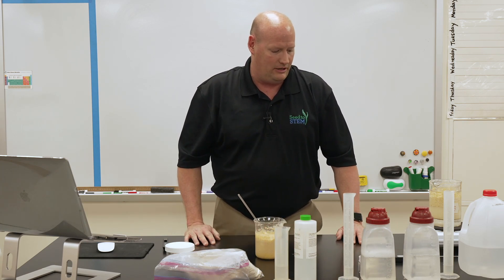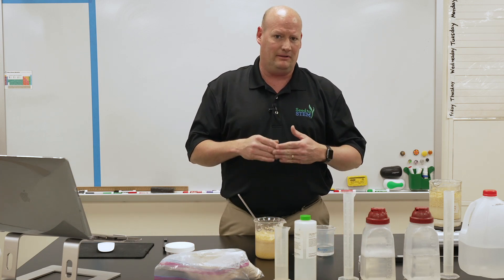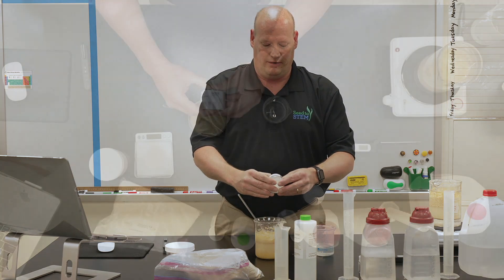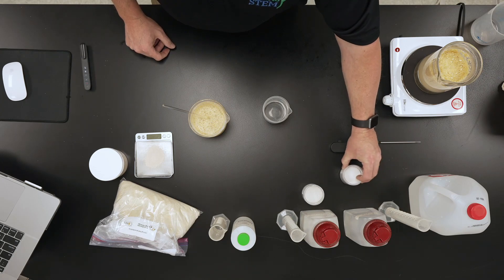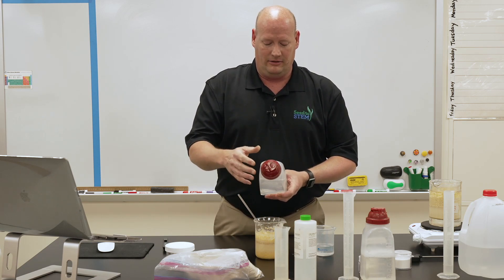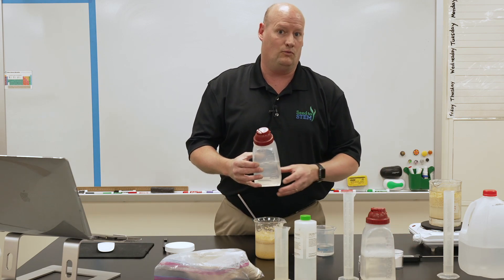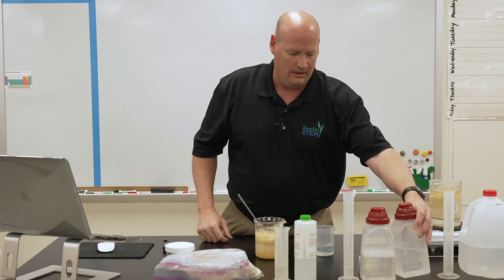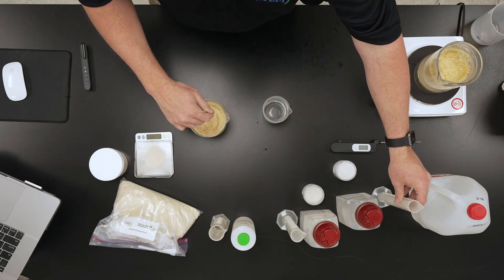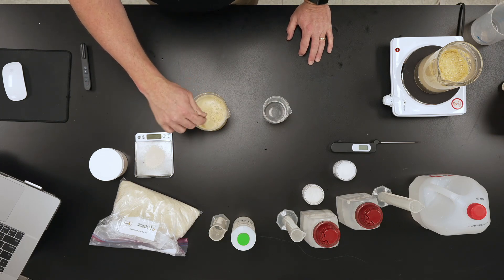To get the mixture ready for fermentation, we have a beaker with 100 milliliters of distilled water and we're going to add 10 milliliters of our amylase solution. Amylase is an enzyme that comes in a powder form, and it's all provided to you. To prepare the solution, it is one gram of amylase enzyme per 100 milliliters of water — shake that up to activate the amylase. Add the 10 milliliters of amylase solution and stir for 5 to 10 minutes to get it nicely activated.